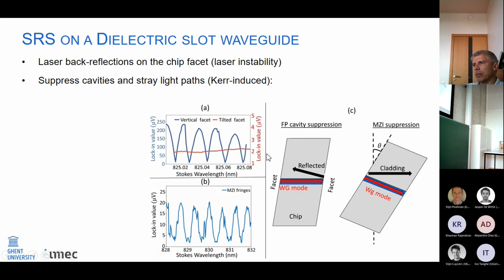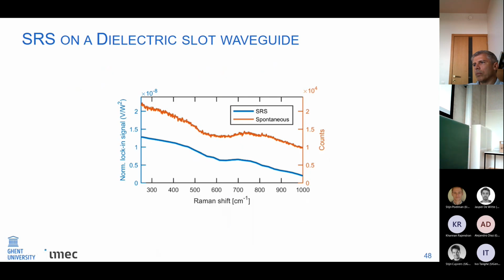And in the same way, you have to put your chip under an angle during measurements to make sure that the cladding light and the waveguide light end up in different spatial positions, and you will not have this interference. Then you can see here that you will not get disturbed anymore by these fringes. So after all these things, I can actually measure SRS on a dielectric slot waveguide.